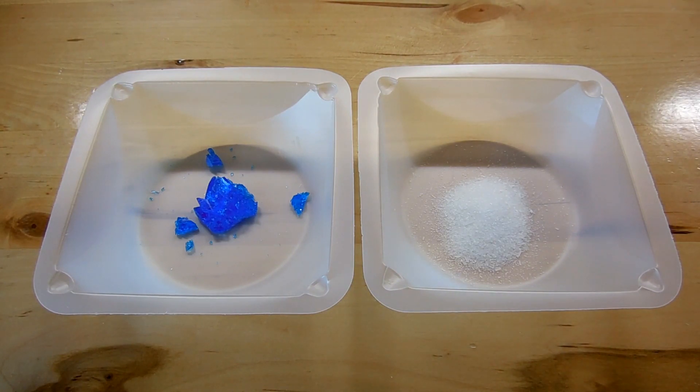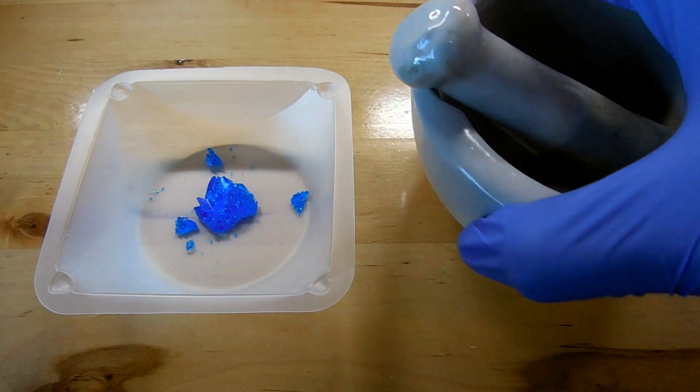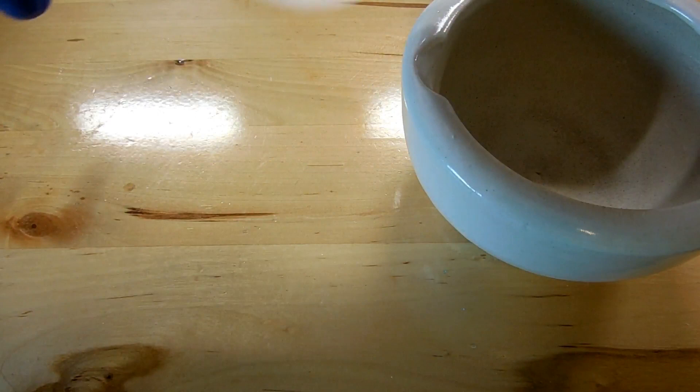So now I need to dissolve both of these into water solutions, and before I dissolve the copper sulfate, I think I'm going to grind it down into a powder so it'll be a little bit quicker.